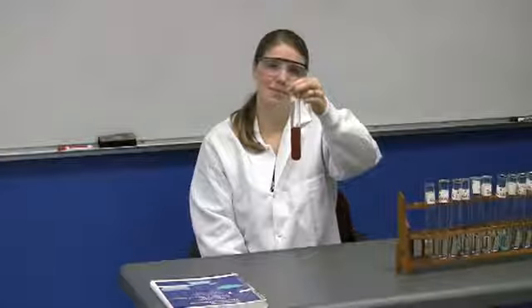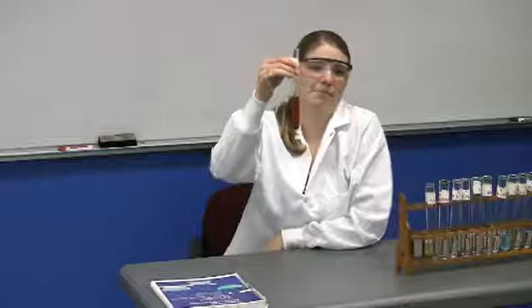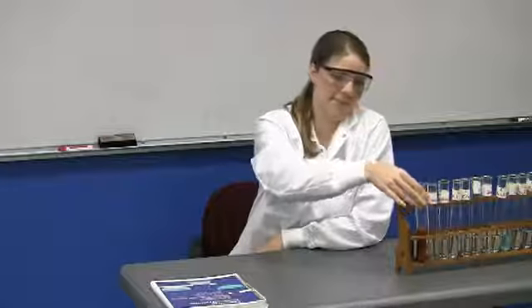And they have a handout that I'm holding right now. Jennifer just combined HgCl2 and Na2CO3, and then the students, when they complete the equation, write (aq) after the appropriate formula of the compound, and they write (s) after the compound that forms a precipitate. Now, how do they know what compound that is? They use the solubility rules from the textbook. Okay, so that was kind of a brown precipitate, right?